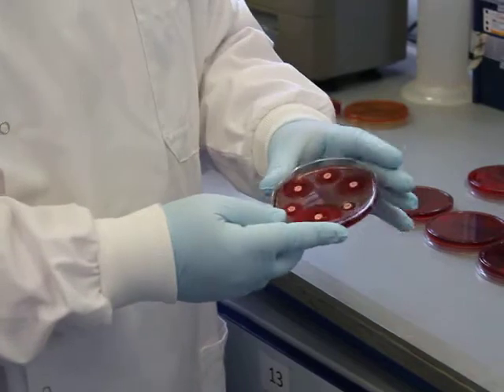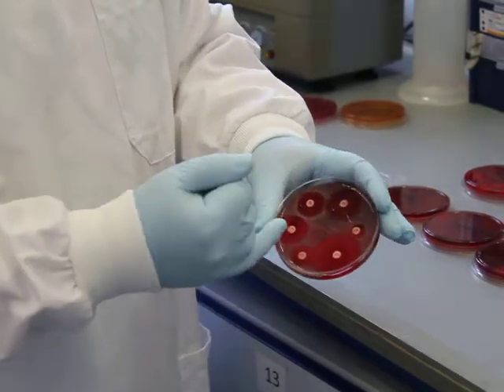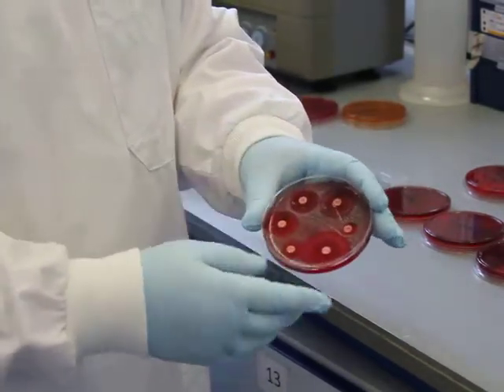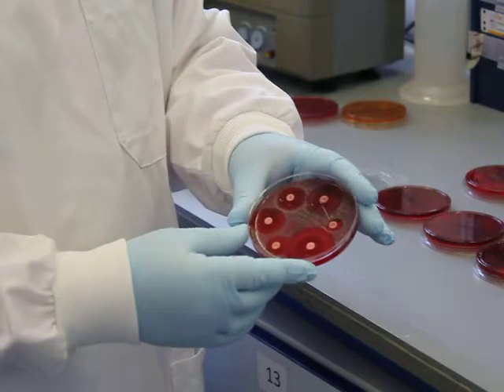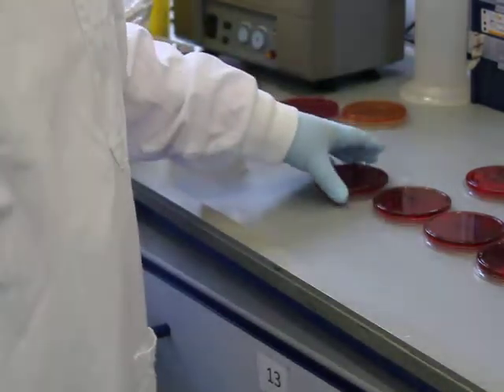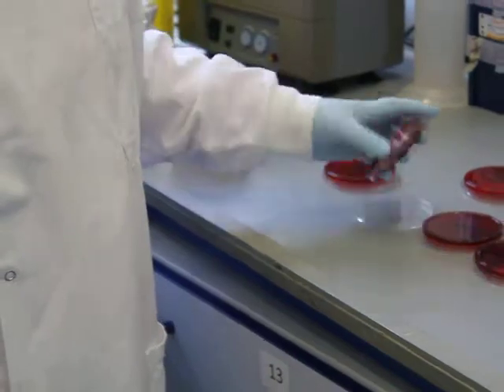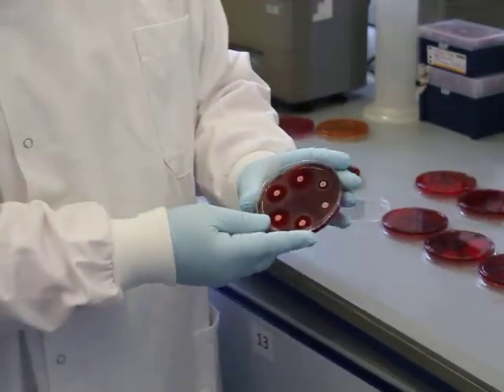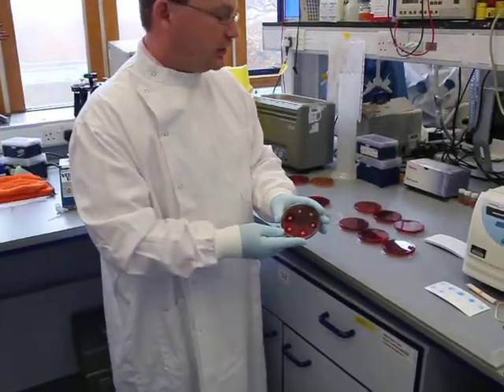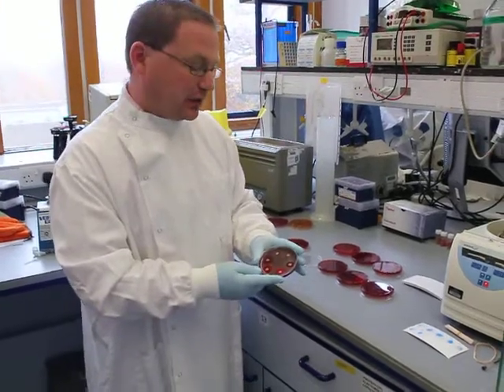So, what we would do in the laboratory now is we would measure the zone sizes of inhibition around each of these antibiotic discs, record those, and then we would do the same for each of the discs for the isolates we've acquired from the patients and the medical staff.